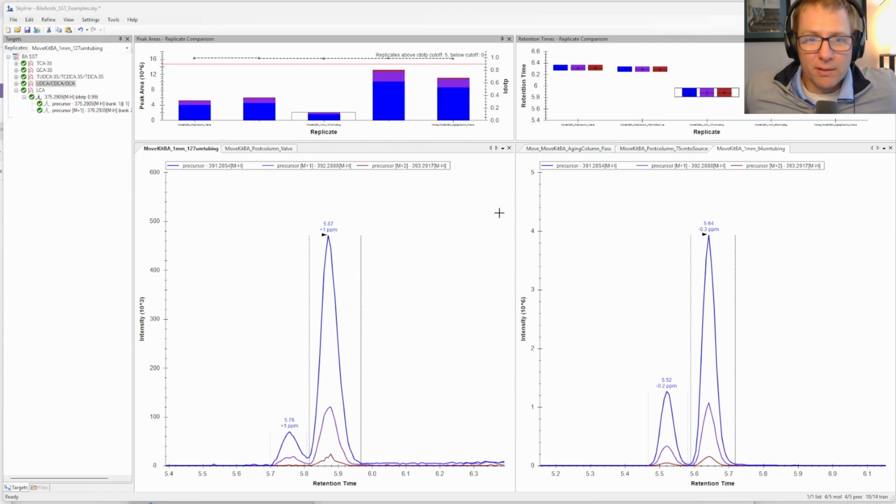So really very little else about this separation is expected to be different. And the resolution here undergoes a pretty drastic improvement just from changing that post-column tubing. So remember to use the correct inner diameter, and remember you get double the bang for your buck for inner diameter reduction as opposed to length. Length increases broadening linearly, whereas decreasing the internal diameter decreases broadening squared.